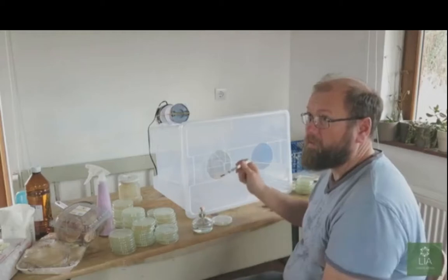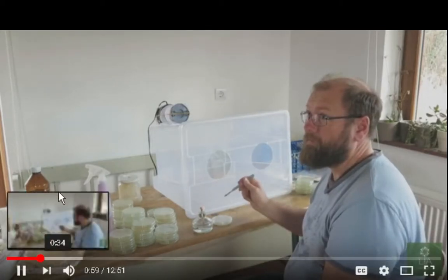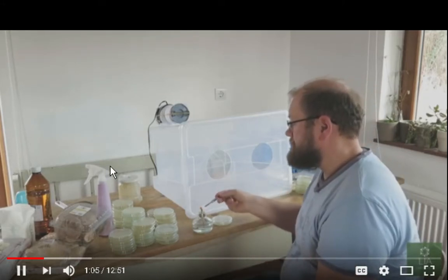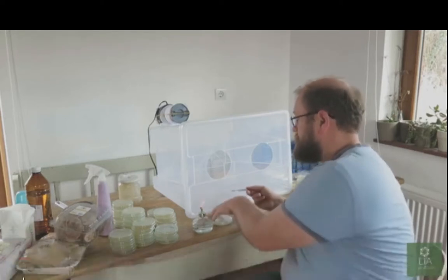I saw that, you just opened up that dish and all kinds of contaminants just got in there. So you're not getting any cross-contamination, yes or no? Okay. No. Never. Sterilize. You have to do that every time.